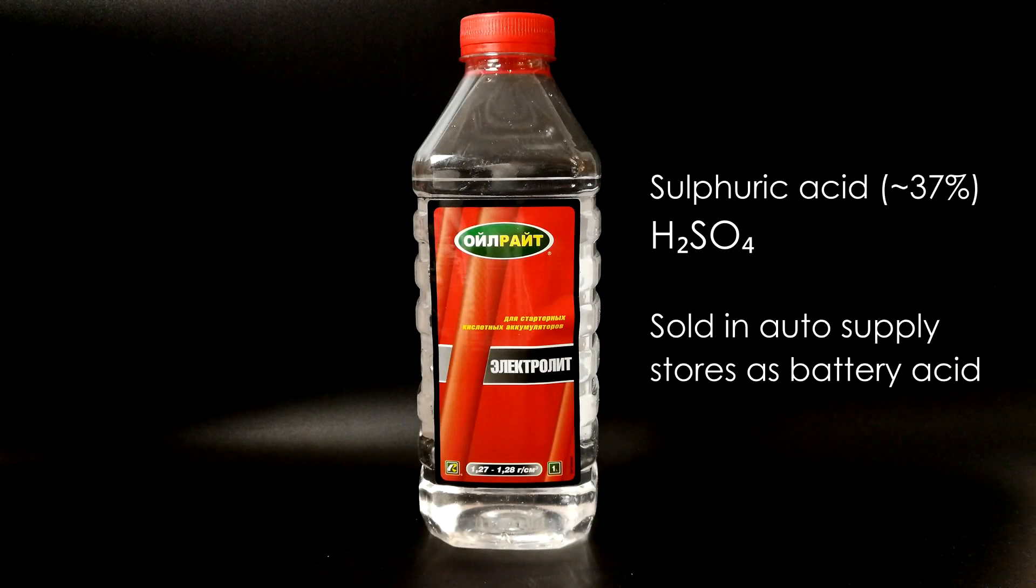We will also need a bit of sulfuric acid, which can be bought in an auto supply store as battery acid.